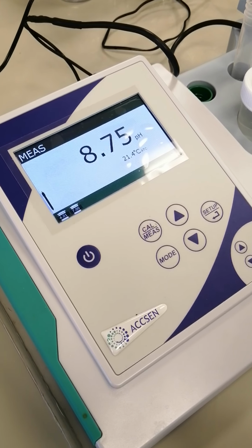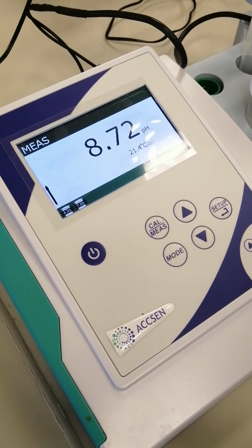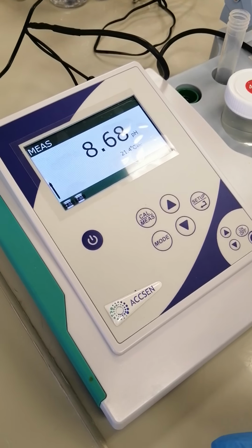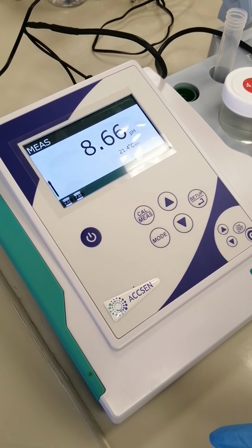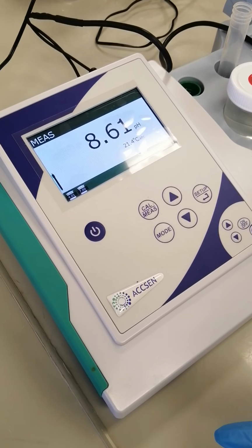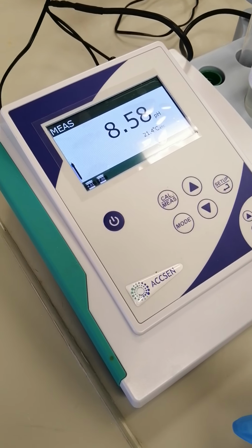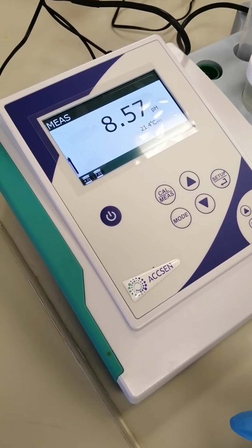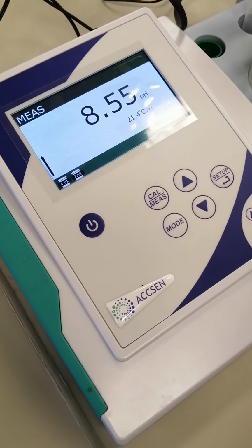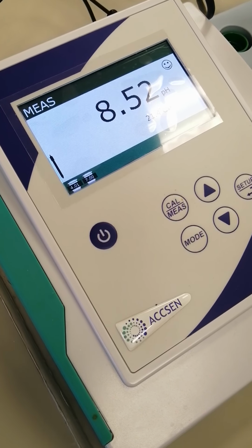It's taking so long. There is our smile.